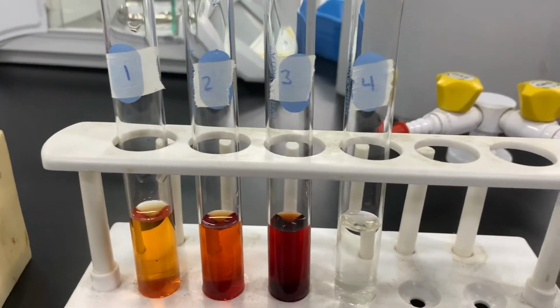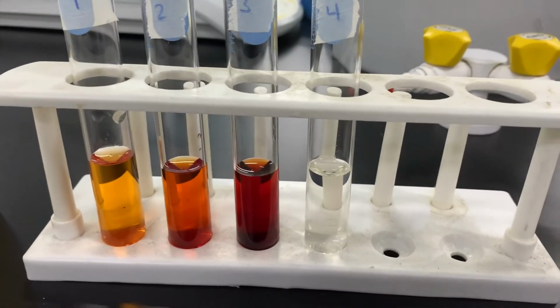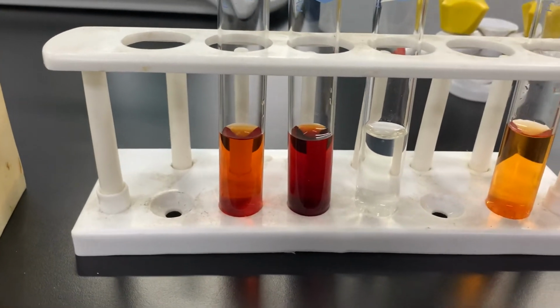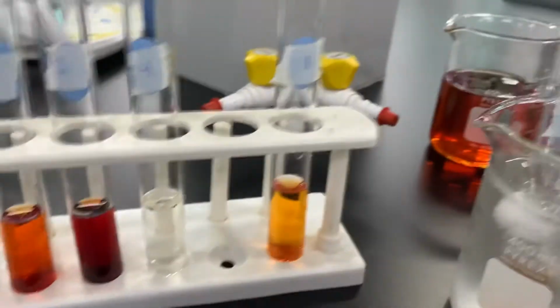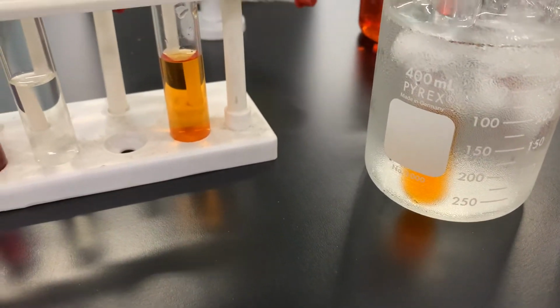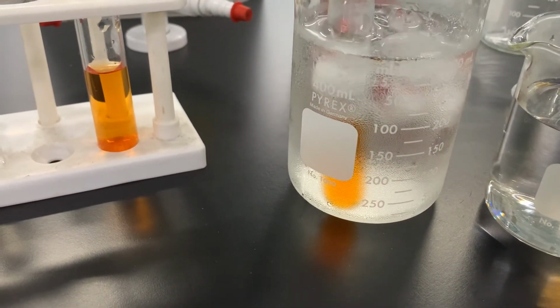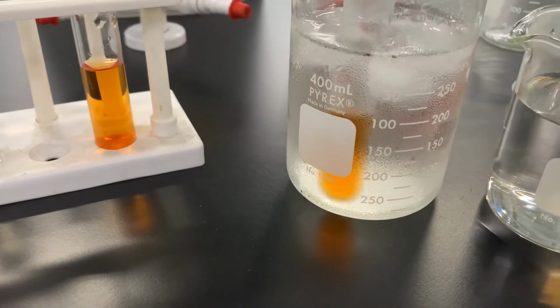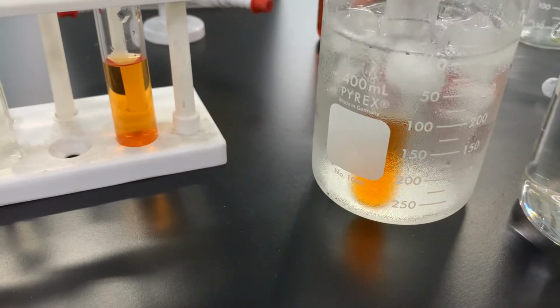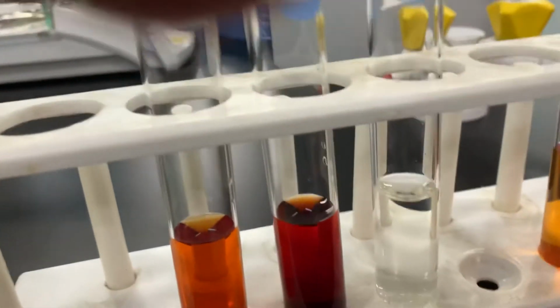If I take a look at model 2, what I had you doing is adding this mixture to hot water and cold water. Let's take a look at what we see. We're going to use this one as our basis for comparison. Here we have test tube 5 and test tube 6, and in each of those, before I started videoing, I put 10 milliliters plus 10 drops of water, just like the other test tubes. This one had 10 milliliters of this stock iron thiocyanate complex. I'm going to take this out, so this is nice and cold, and see if there's any difference between here and here.